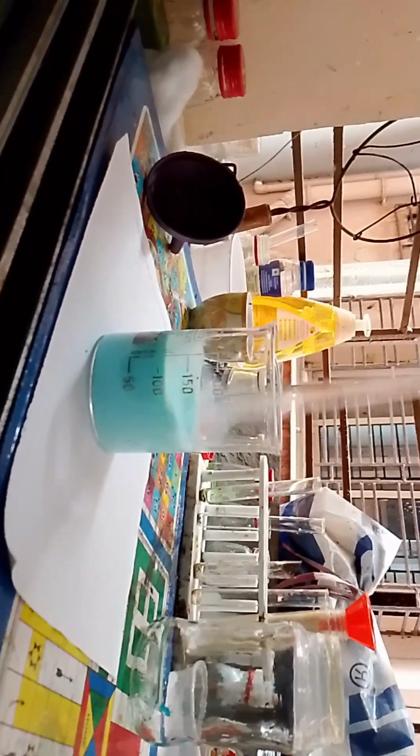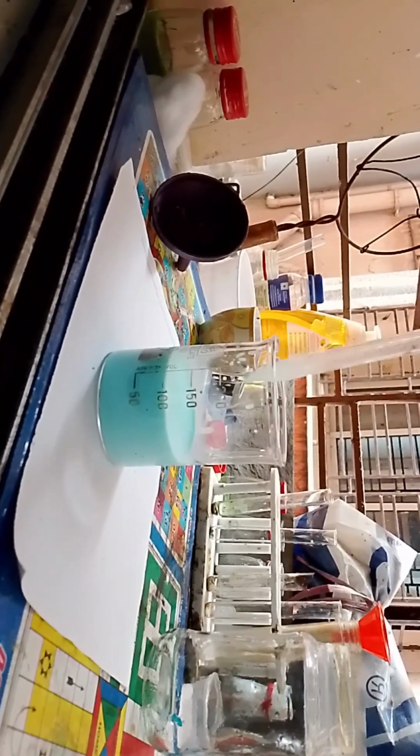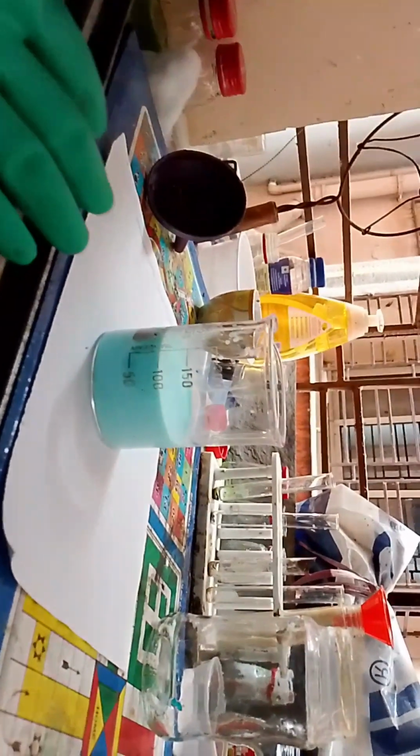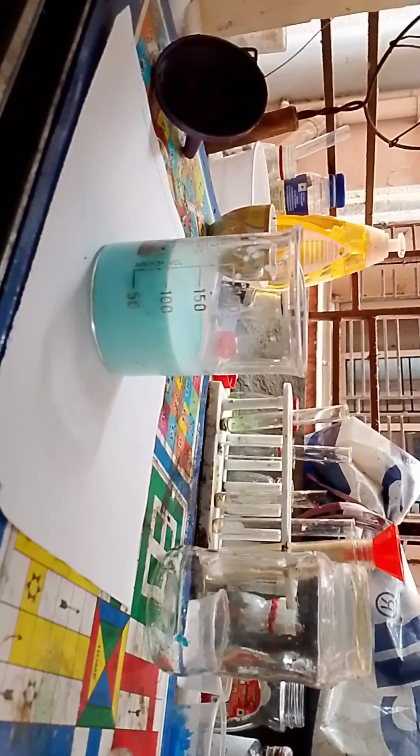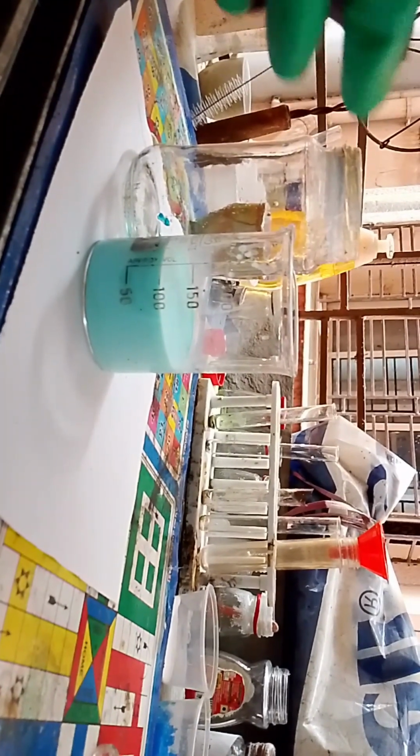Now we are going to stir the solution a little. Okay, you can see the solution has become totally unclear and it is now a colloid solution, and you will see a layer of sulfuric acid separating out as soon as it stays still for a few minutes, which you can see as a little thin film. But we are not going to leave it for very long because we are going to filter the solution off, because we want to save time.